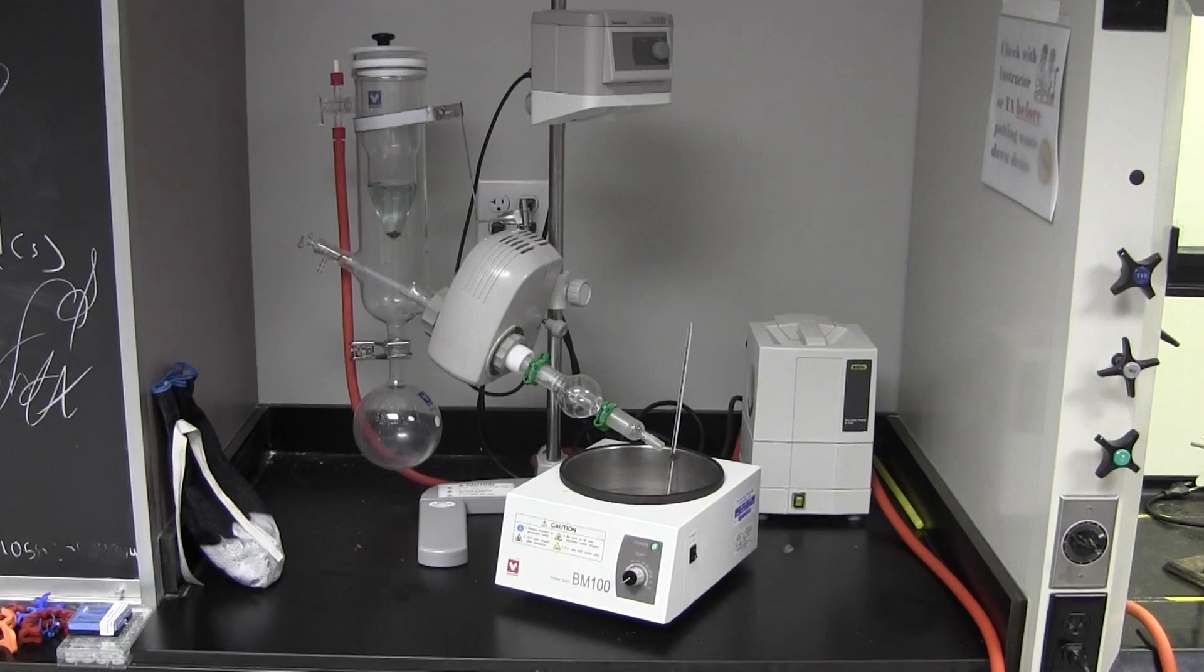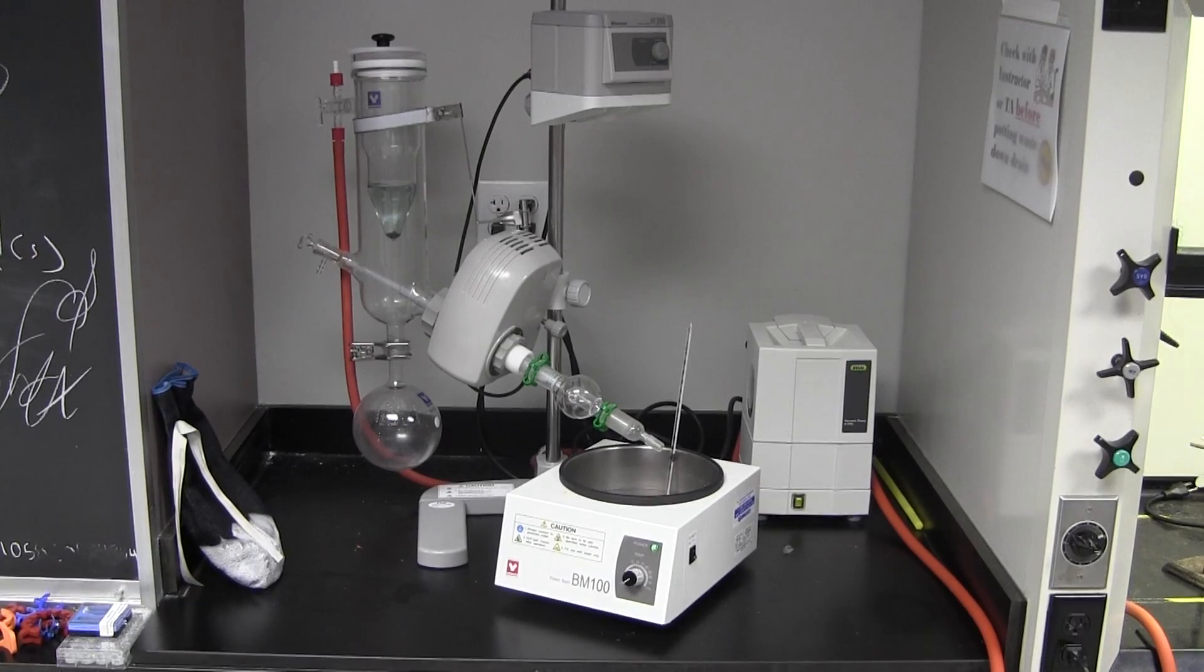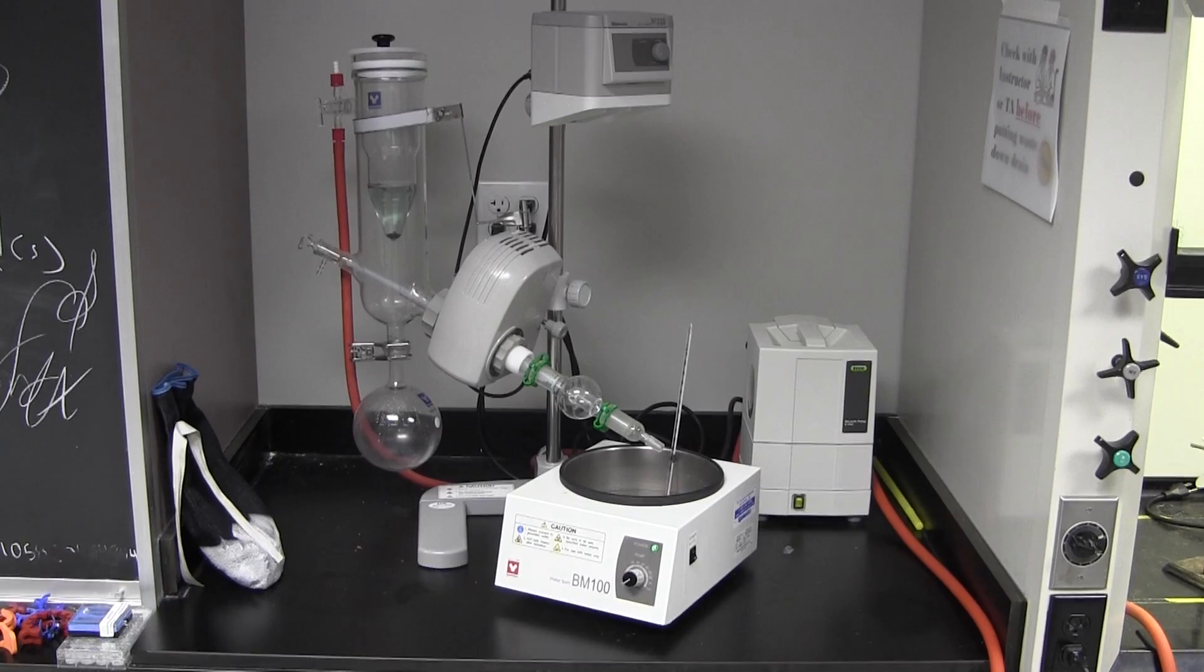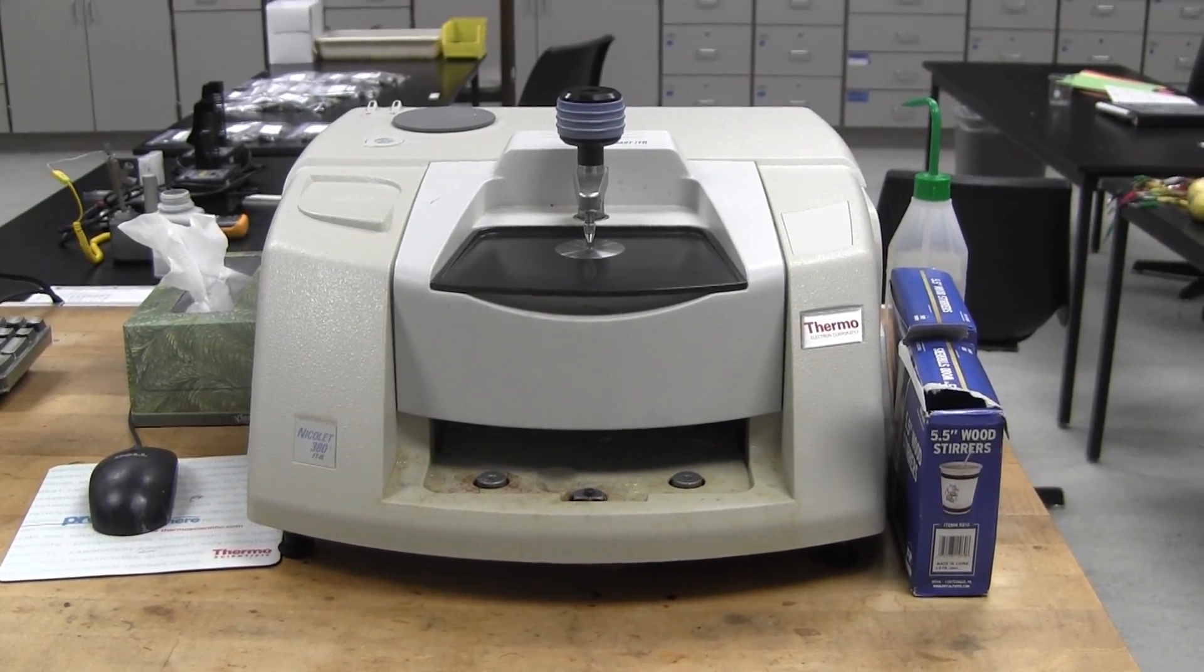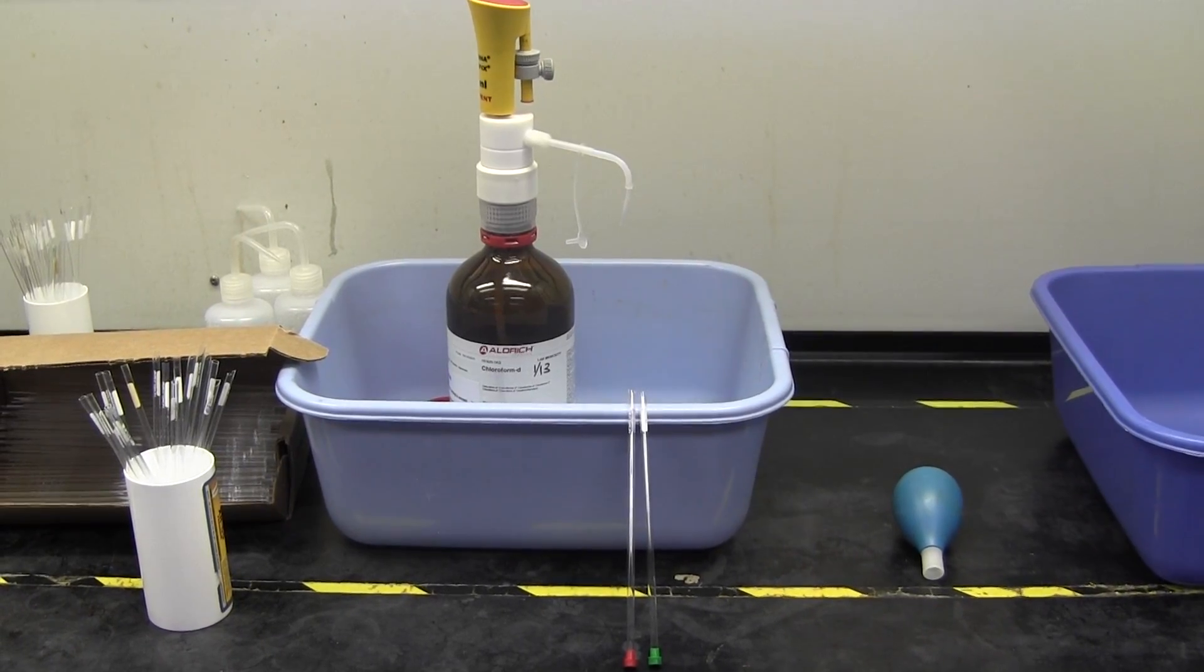Then, use the rotary evaporator to dry your unknowns. Make sure to gather the percent recovery, IR, melting point, and NMR data on both unknowns.